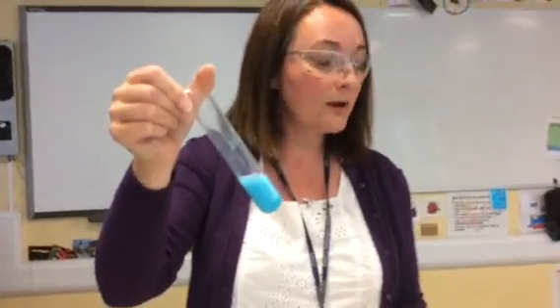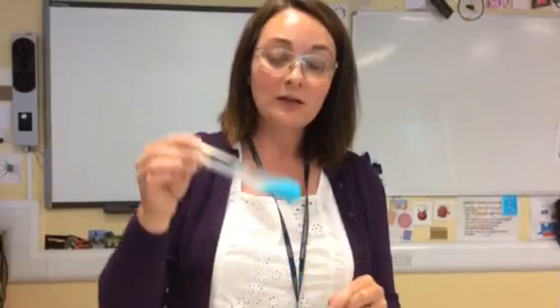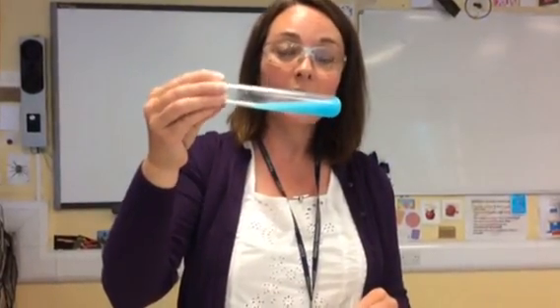Okay, so have a go at writing your observations on your sheet, and then you need to list the elements. So ammonium hydroxide is a tricky one. It's got the formula NH4OH, and then copper sulfate has the formula CuSO4. So let's see if you can list the names of those elements on your sheet and write down the observations for ammonium hydroxide and copper sulfate. Okay, thank you.